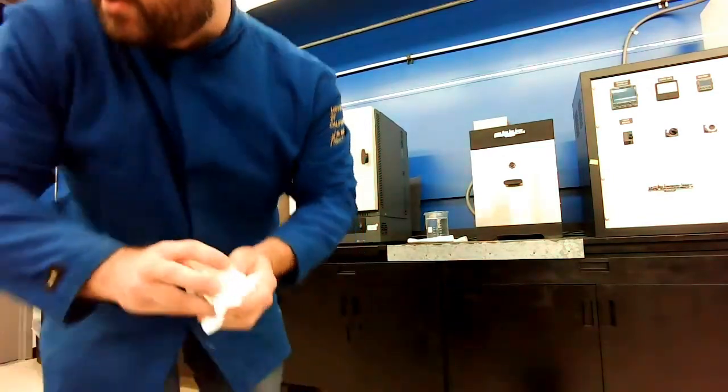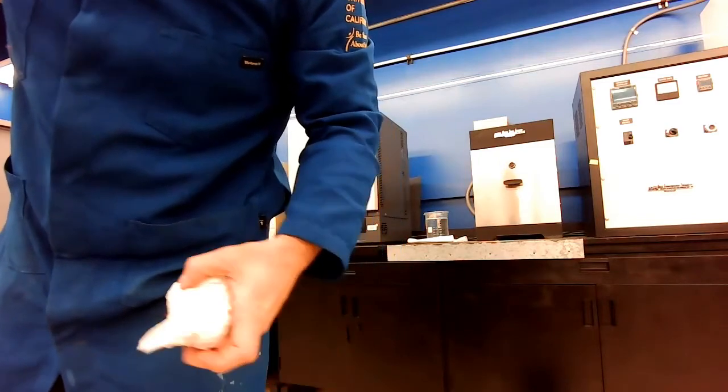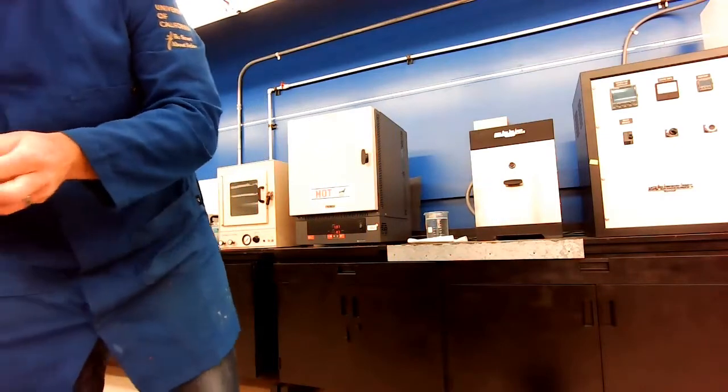I'm going to take that other one out. It's going to look very similar. And it should. It basically went through the same process.